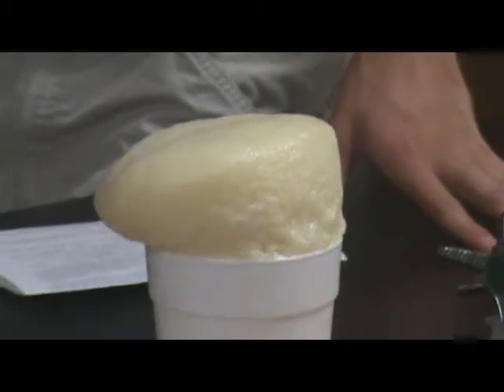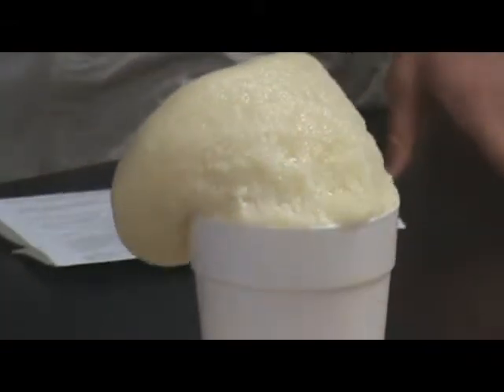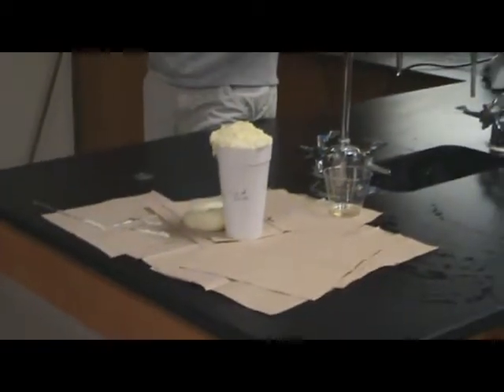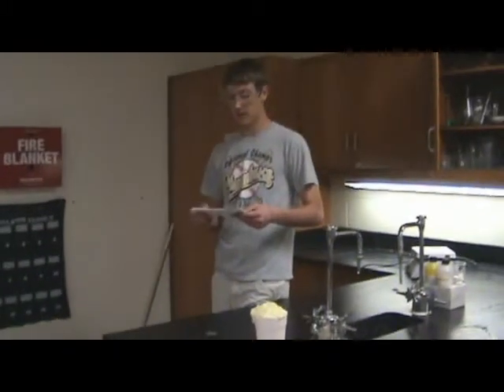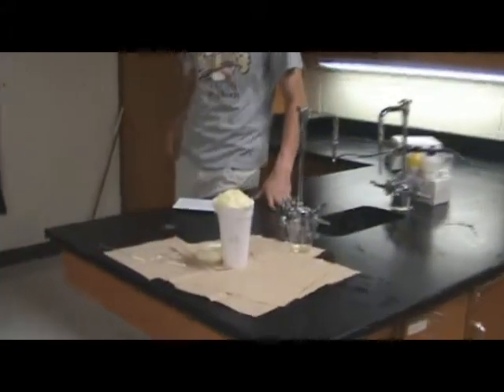How many of you have seen the sprayed foam they put in walls, where they put drywall up? What is actually happening is during this polymerization reaction, there's a small amount of water in there that reacts with the diisocyanate (Part B), and it starts decomposing and produces carbon dioxide gas — all these little bubbles inside — which actually makes it expand.